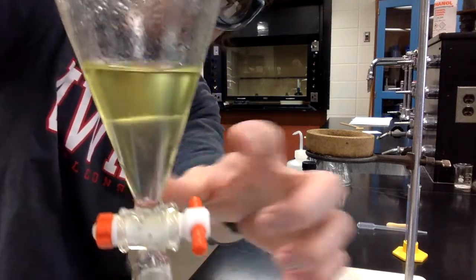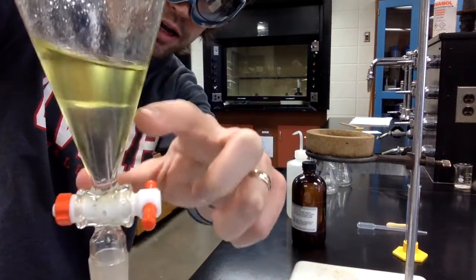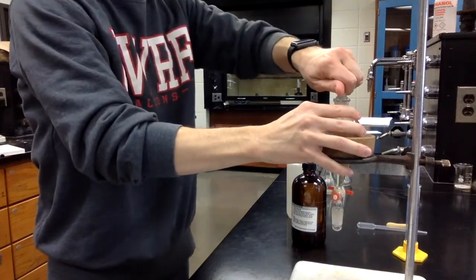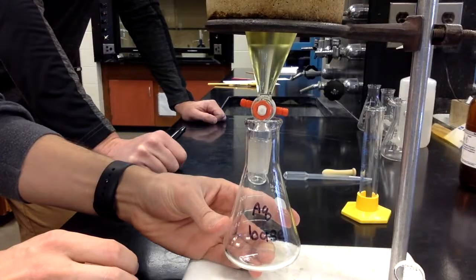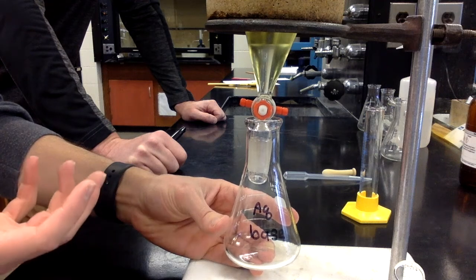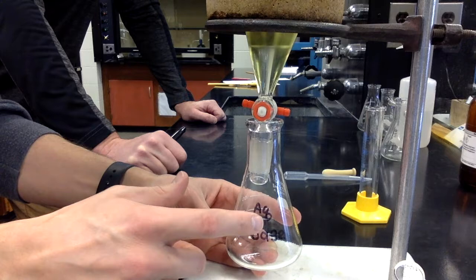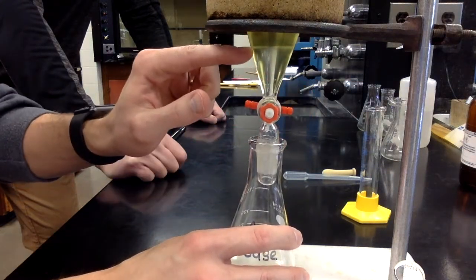And we have, again, our organic layer on the top because it's mostly MTBE, and then our aqueous layer on the bottom. So now we're going to separate these layers, and we're going to add them to different Erlenmeyer flasks. Okay, now we are going to drain the bottom water layer, which is our 1 molar sodium hydroxide layer, into this Erlenmeyer flask that has aqueous base on it. And you can see the 2 layers has the interface right there.